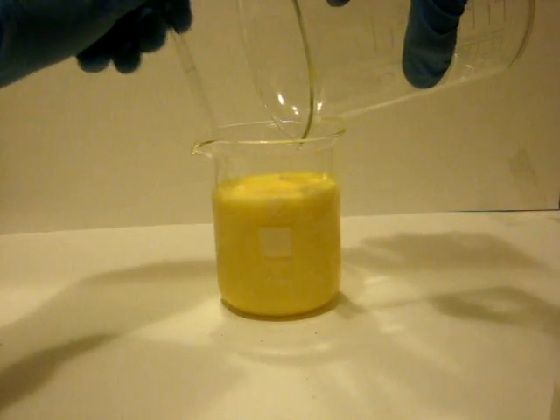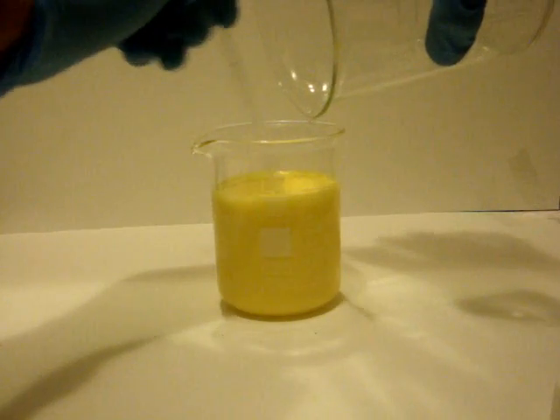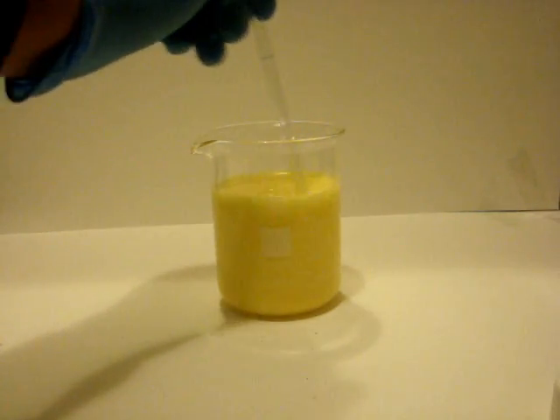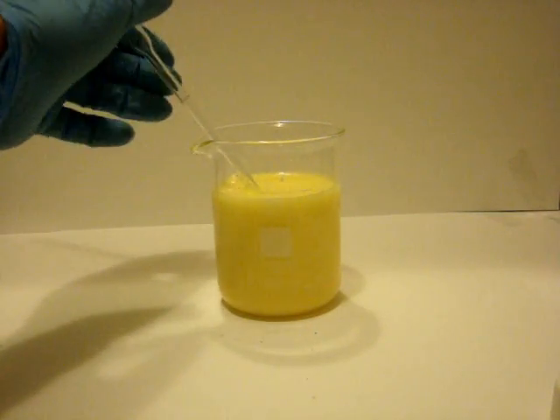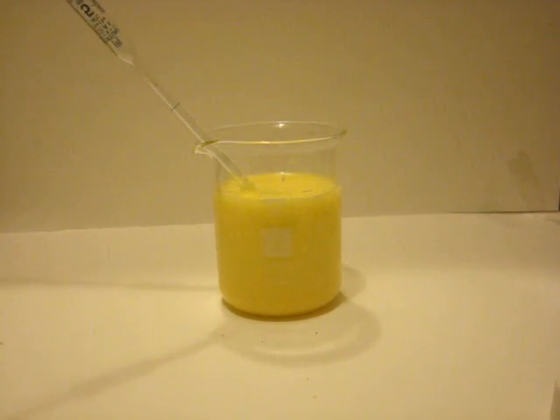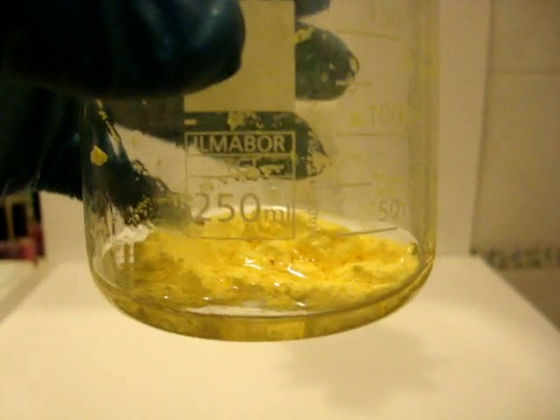After a little bit the compound will precipitate and you will be able to filter the particles that won't precipitate immediately, but this is optional. Now you can see the product. Let it dry and now you have iodoform.